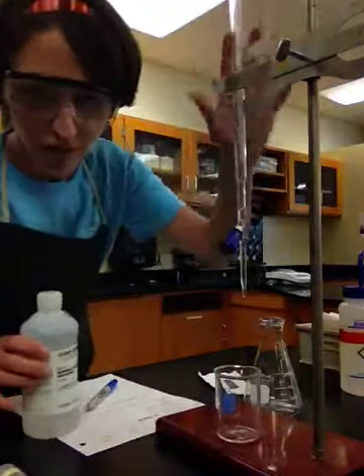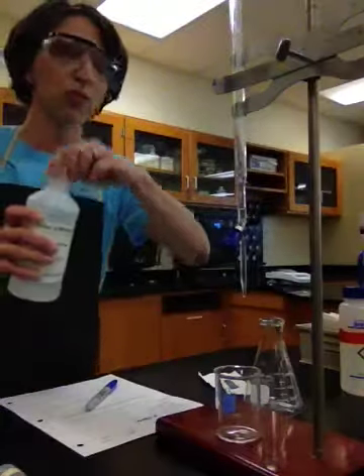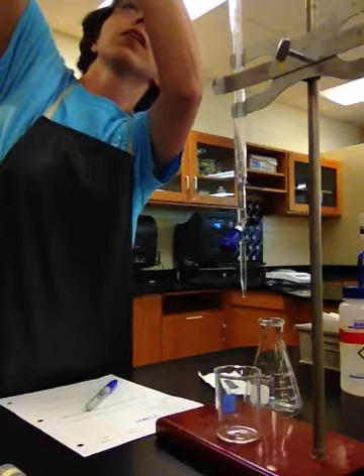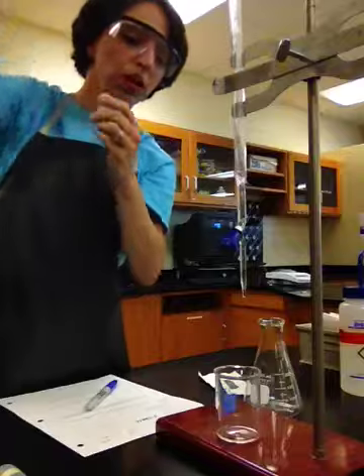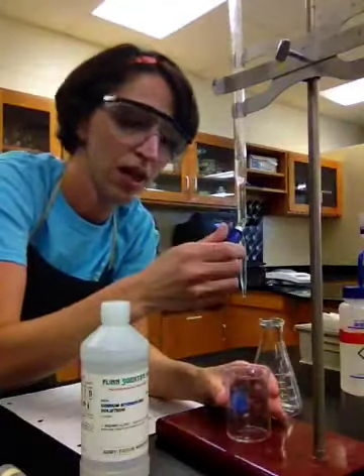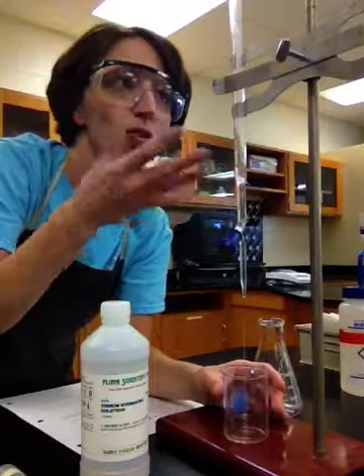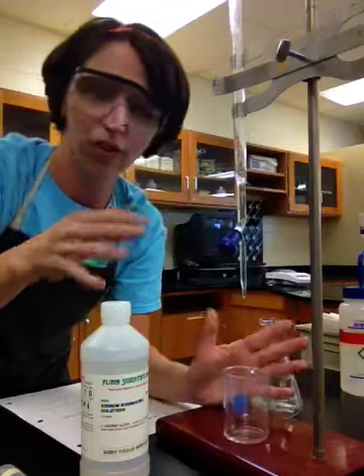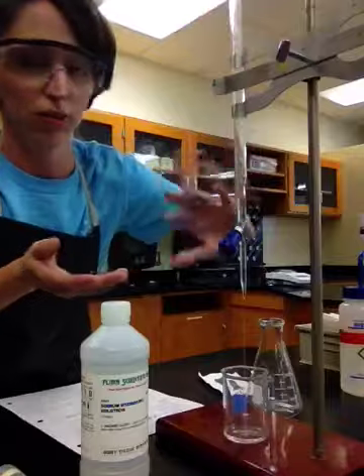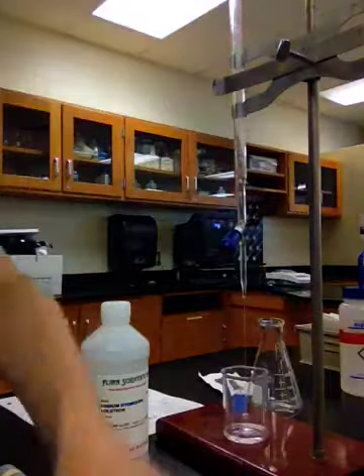Now, I've already rinsed the burette with distilled water to make sure it's clean. Now what I'm going to do is I'm just going to run a little bit of the base through. Okay, and the known solution, we sometimes call it the titrant, okay? And I'm just going to run it through the bottom. I'm kind of like coating the sides with sodium hydroxide solution to get rid of the distilled water, okay? Because if the distilled water stays there, then that's going to dilute whatever's in there, okay? So now the sides are coated with the sodium hydroxide, okay?